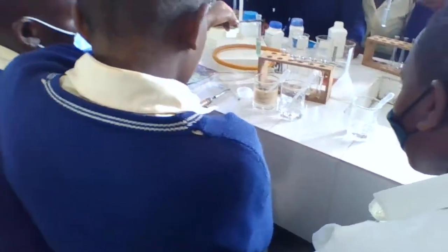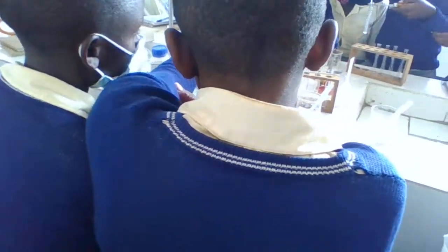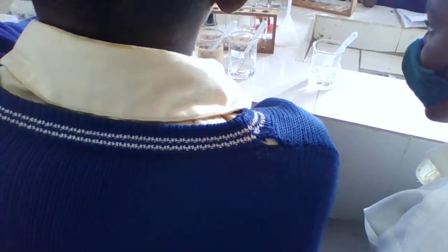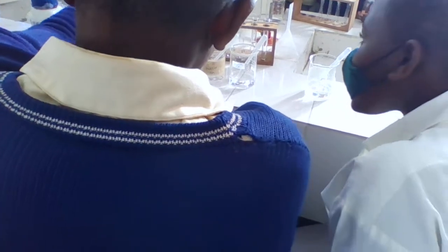What are you observing? Which color? Is it white? This is a white color.